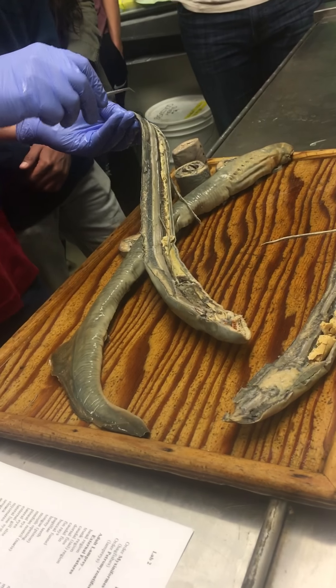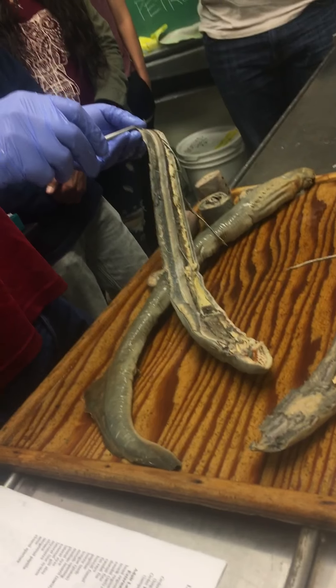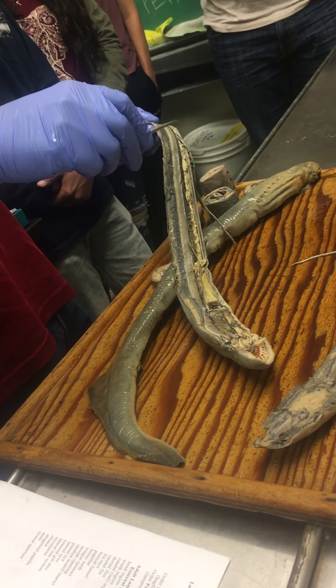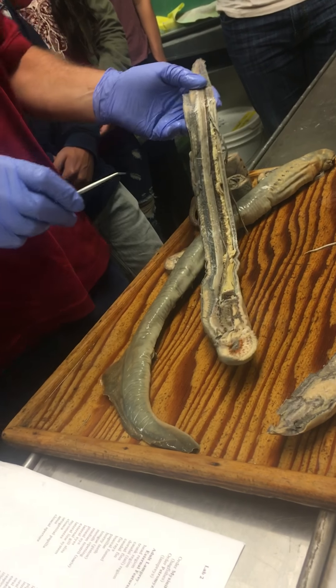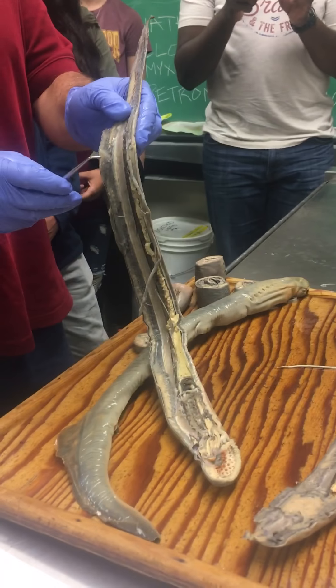If you can't see it all, let me know because otherwise I'm just going to assume you're seeing it — especially you folks in there. So there are some fin rays.